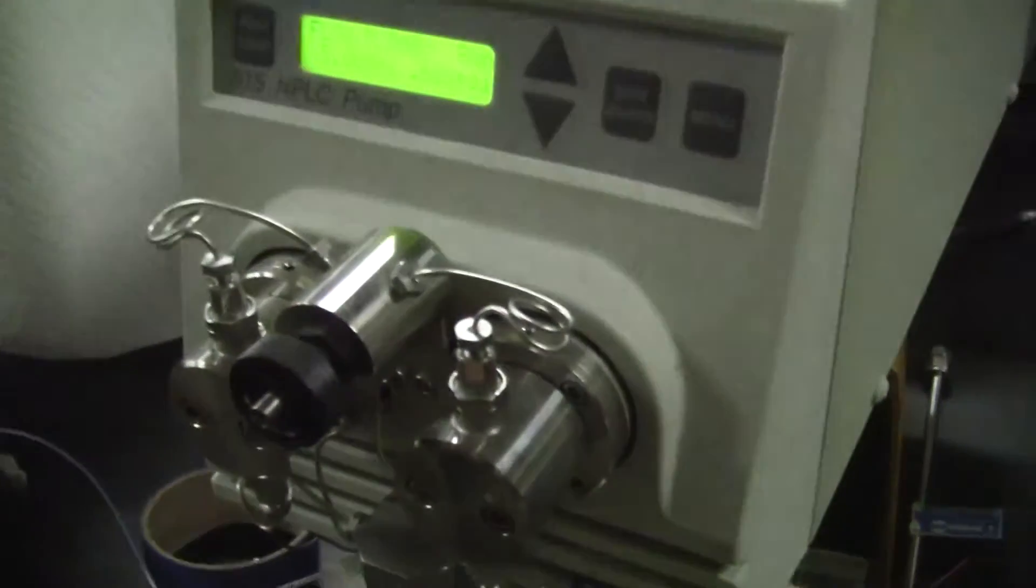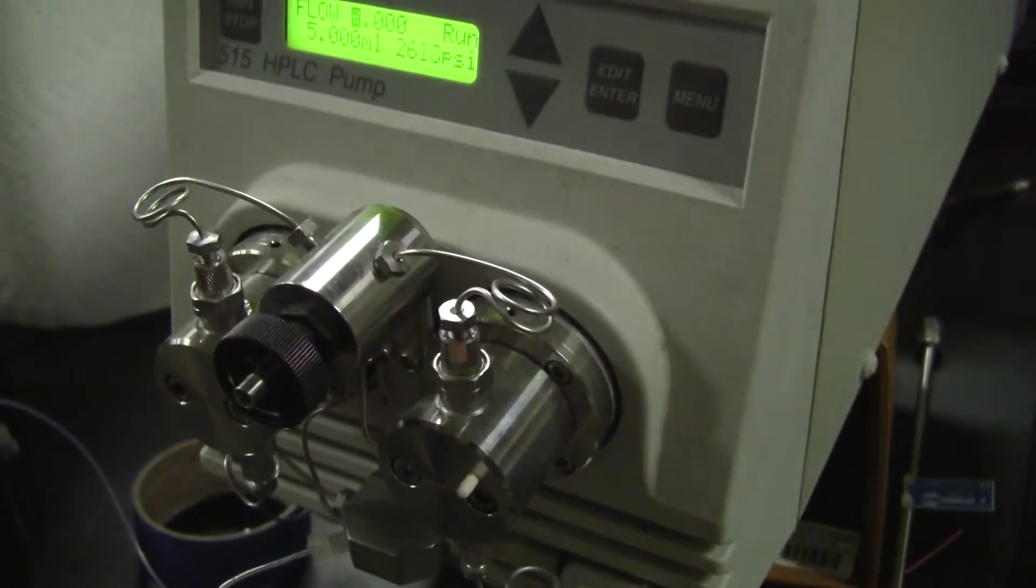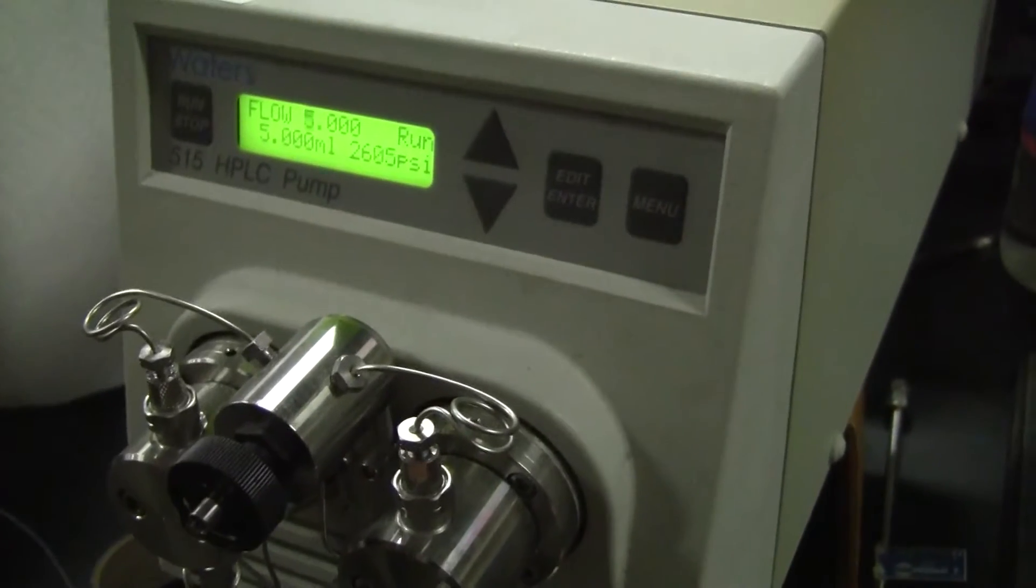So in one minute, we're going to take this out. And what we're going to see is hopefully 5 milliliters of water in this graduated cylinder.